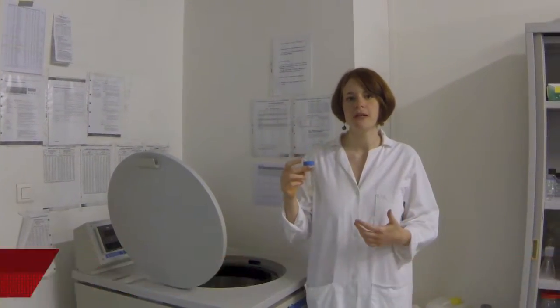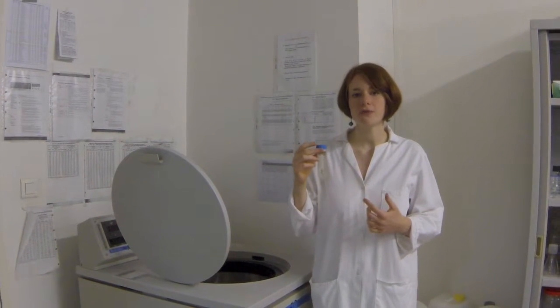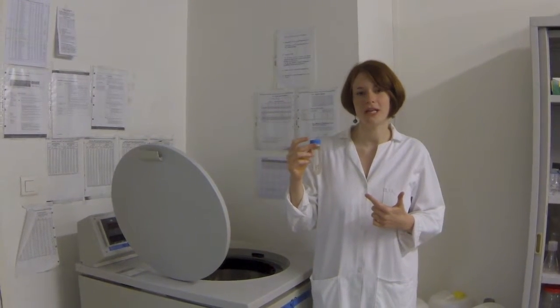If we want to get a product ready to use, for example if it's a medicine, most of those particles have to be removed. We want the final product to be pure, concentrated, and safe to inject in patients. First, cells can be easily removed because they are far bigger than other particles. A straightforward method to achieve that goal is centrifugation.